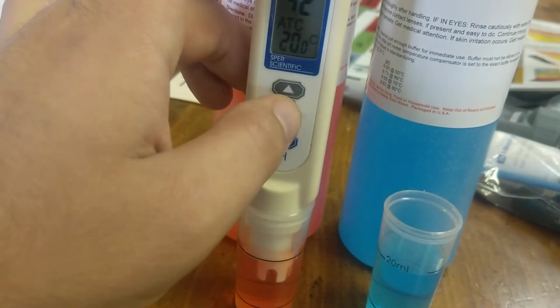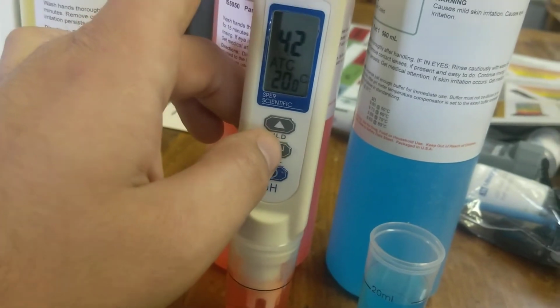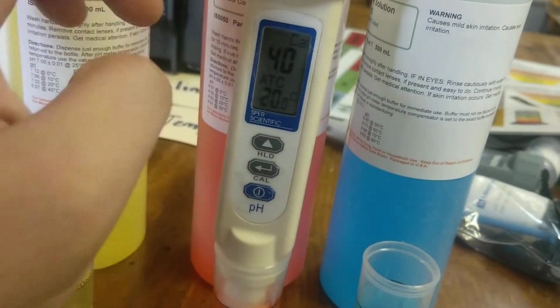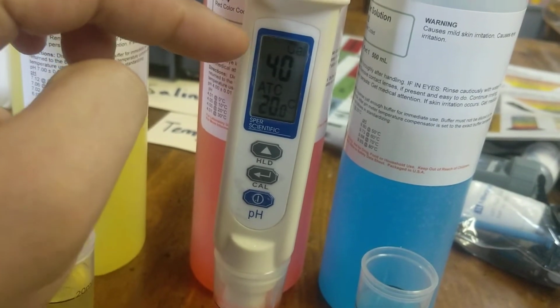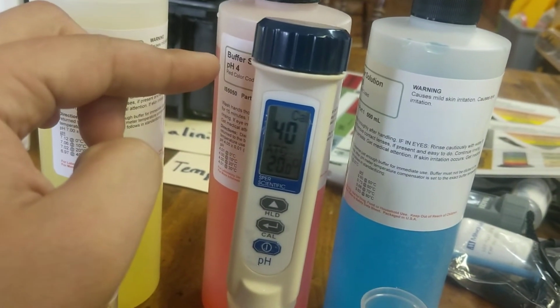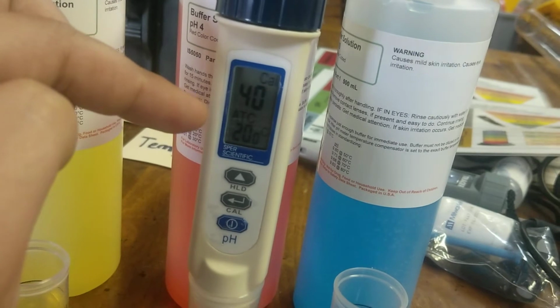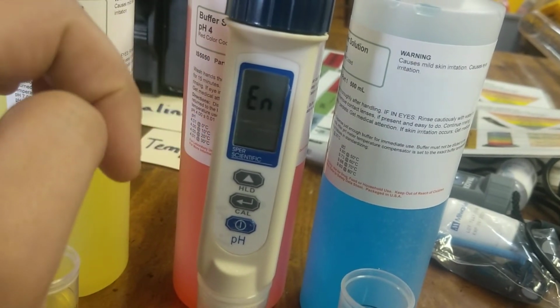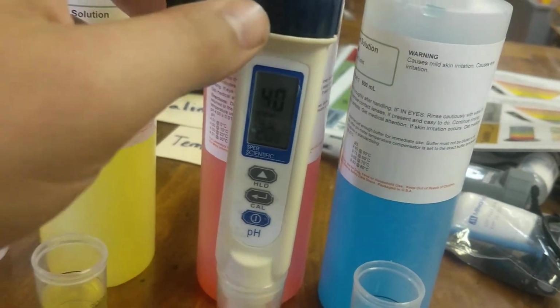And all right, it's kind of stabilized at 4.2, so we're going to calibrate now. So press and hold. 4.0 should come up now. There we go. And that matches the pH 4 here. And it'll say save now, and then it'll say end. And we're good to go.